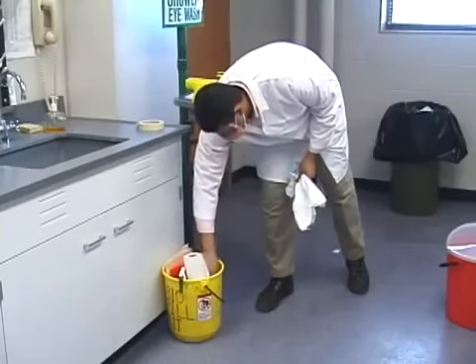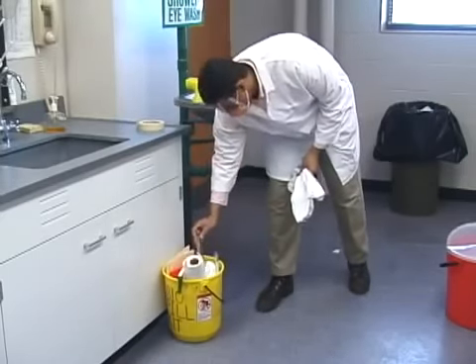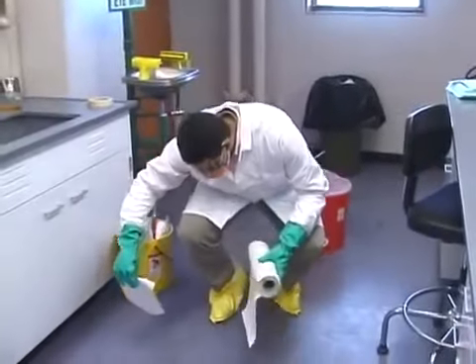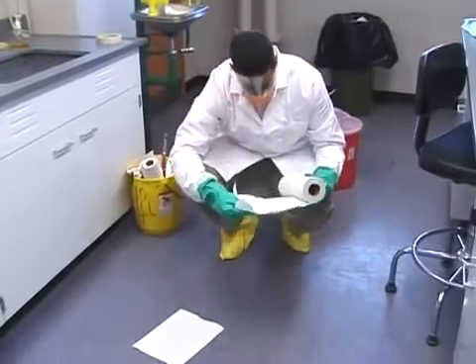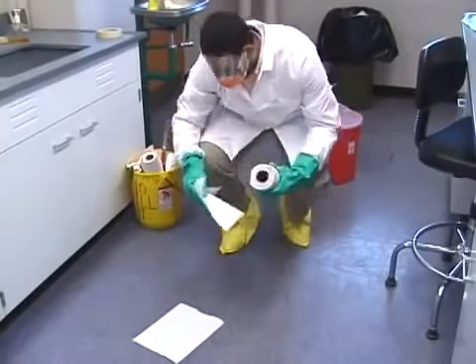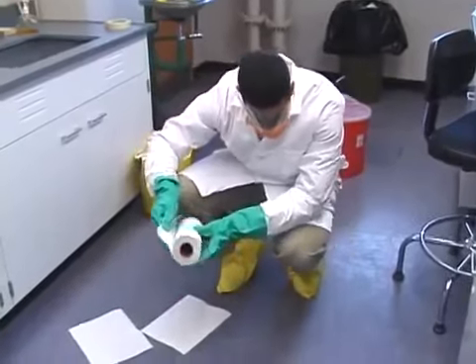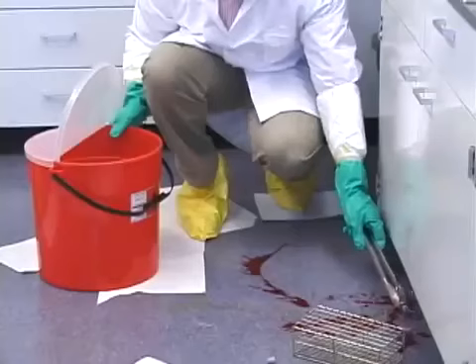Prepare to clean up the spill by assembling your spill cleanup materials and donning your personal protective equipment. For large spills, you will want eye, nose, and mouth protection, a lab coat, 2 pairs of gloves, and disposable shoe covers. When ready, approach the spill cautiously, laying paper towels or other absorbent materials on the blood-splattered areas.